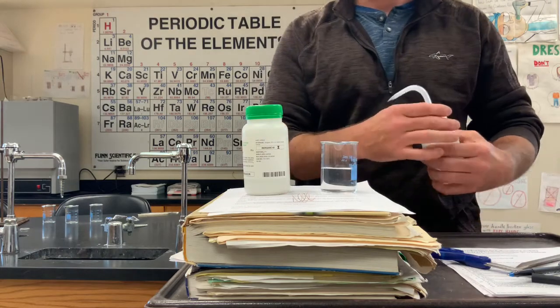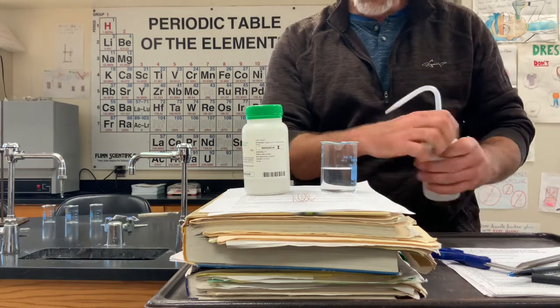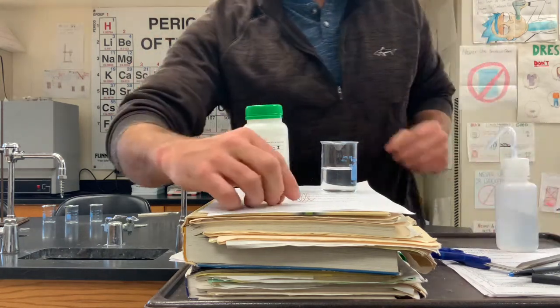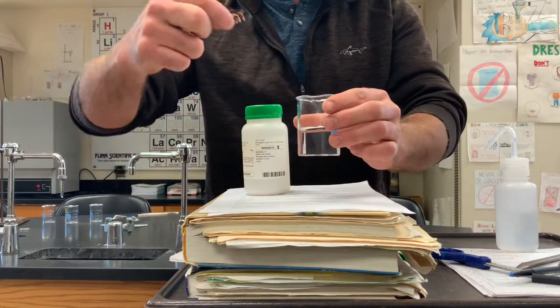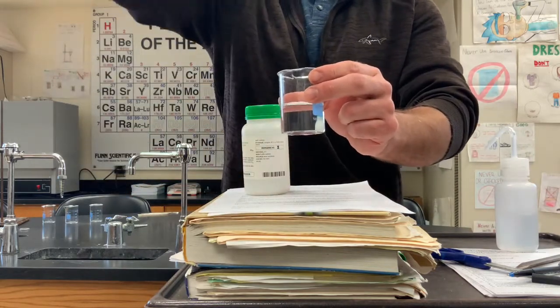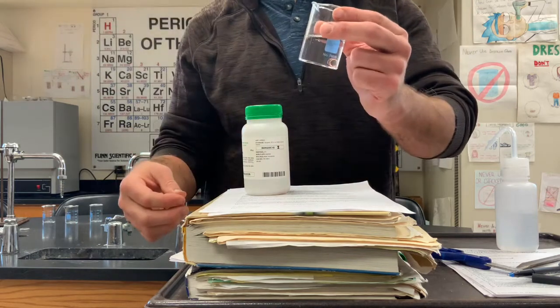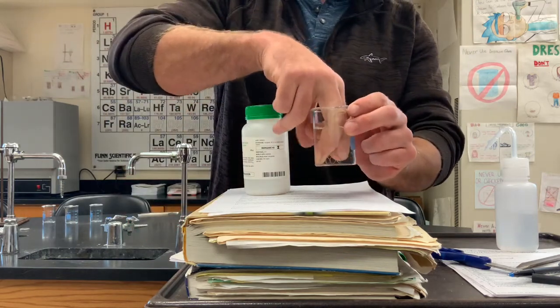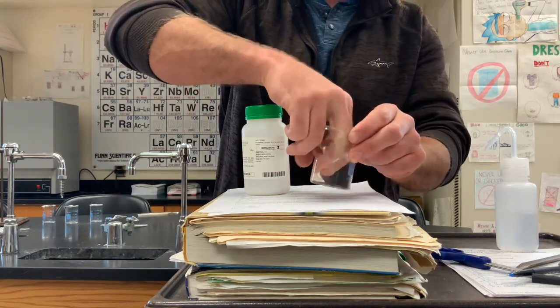Just a little distilled water. What should happen? Well, I'll show you. We're doing different reaction types and if we take copper and we put it into water, 3, 2, 1, nothing happens. It just gets wet. It's copper and that's water.